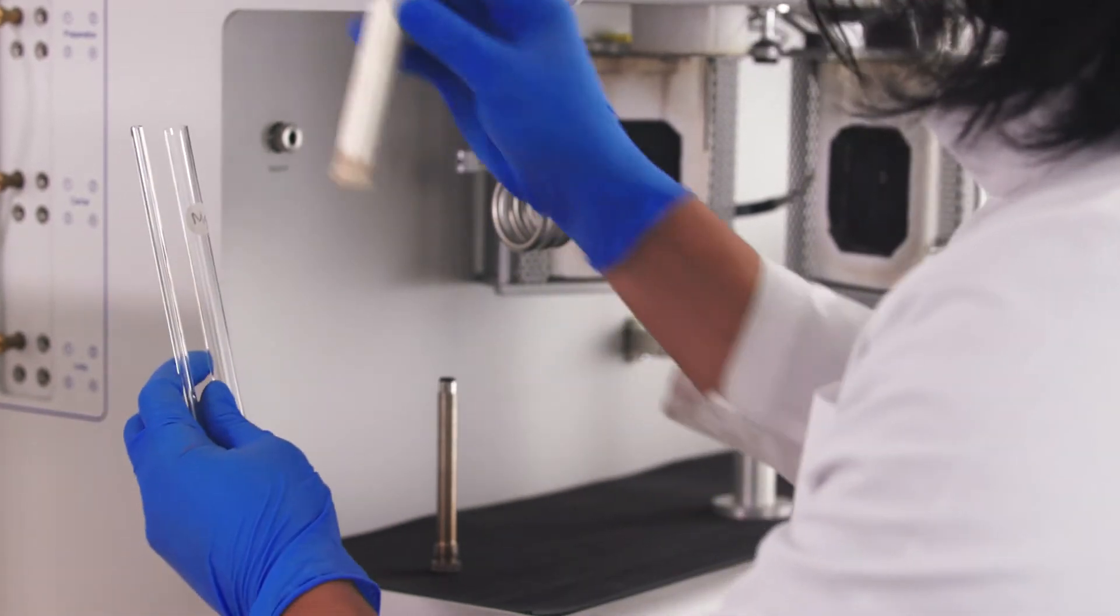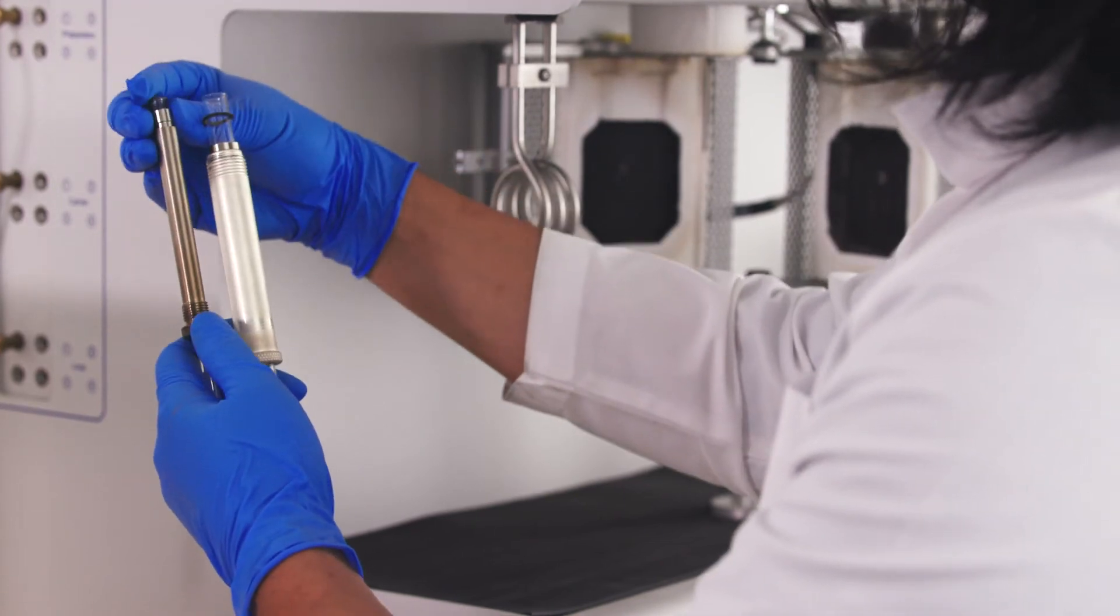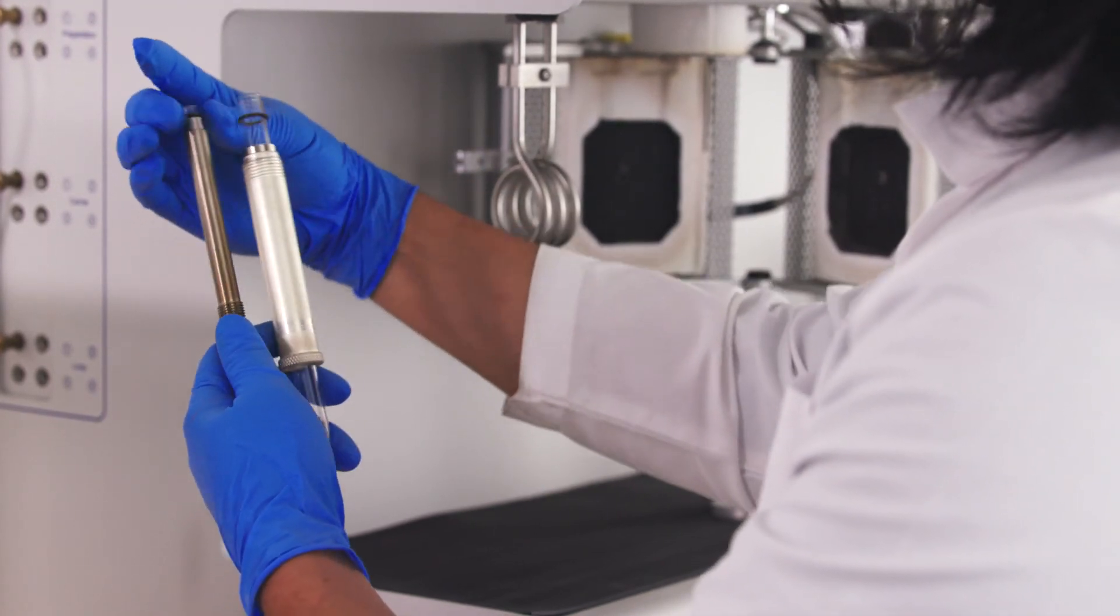Then, attach the sample tube to the AutoChem sample port. Please refer to the sample preparation for the AutoChem 2 video demonstration for more information.